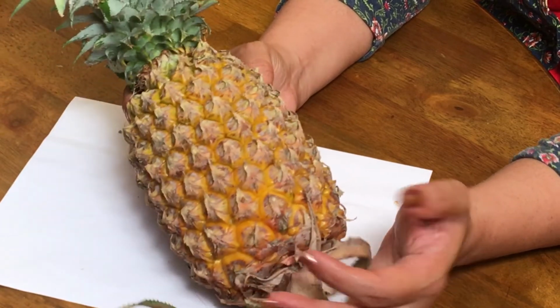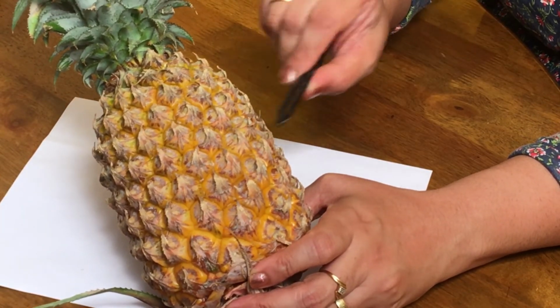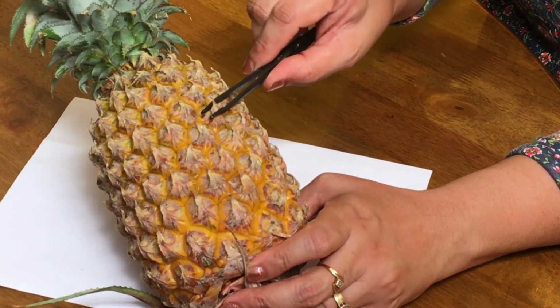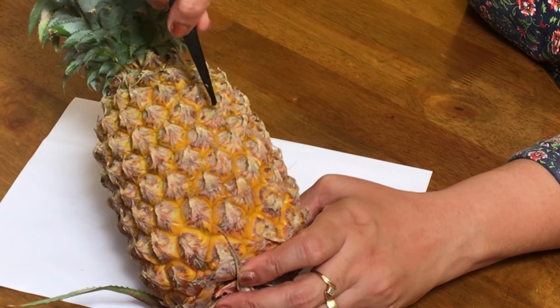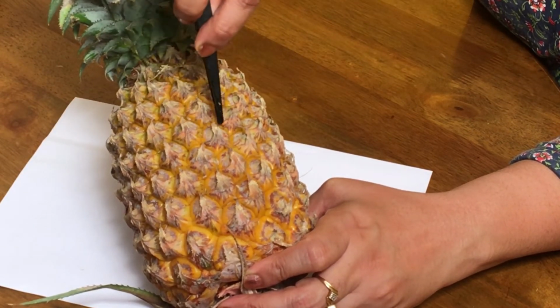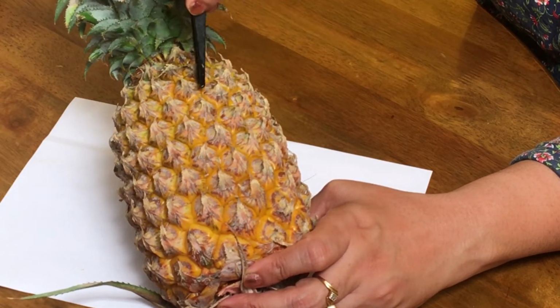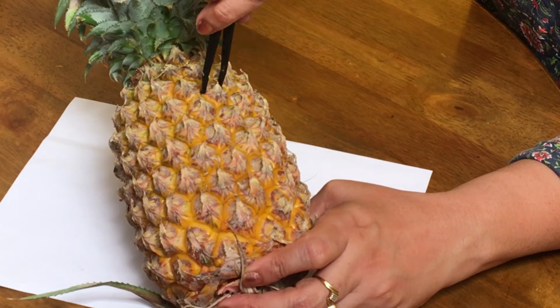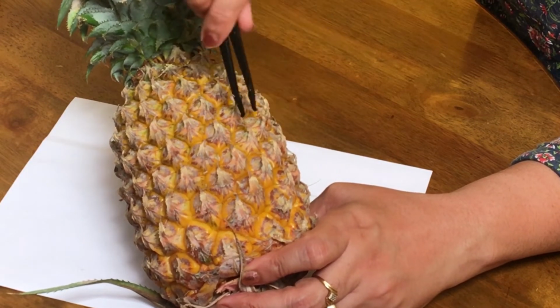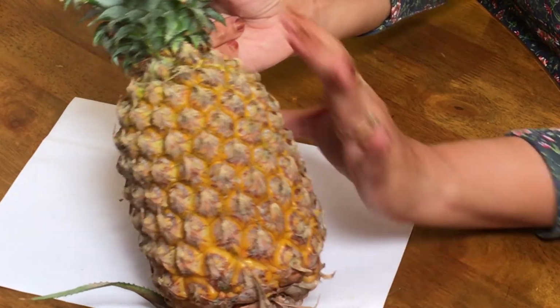Now these spiny outer regions, what you can see here, these are all the bracts of these flowers. These are the bracts of the flower, and each polygonal part which you can see here, this is one polygonal compartment, this is another one. So these polygonal structures are all actually the flowers which later ripened into a fruit. So this was a flower before, so each one was a flower before, and these are the bracts.